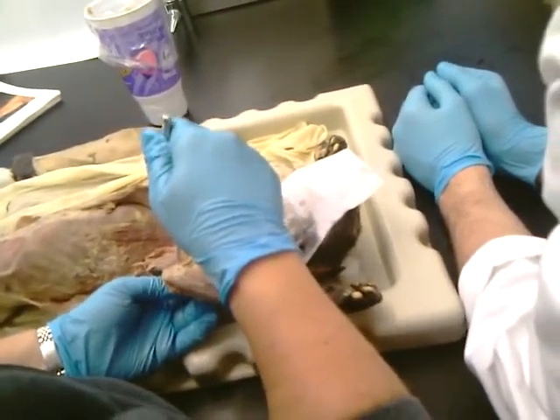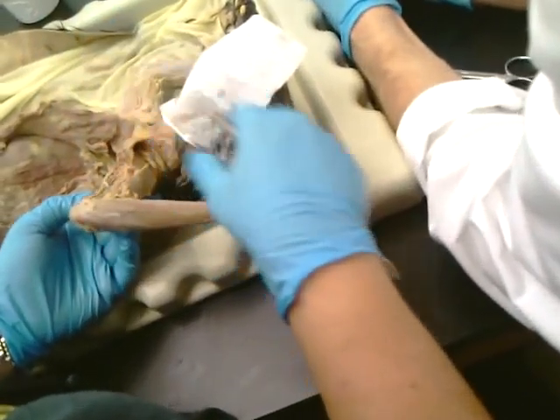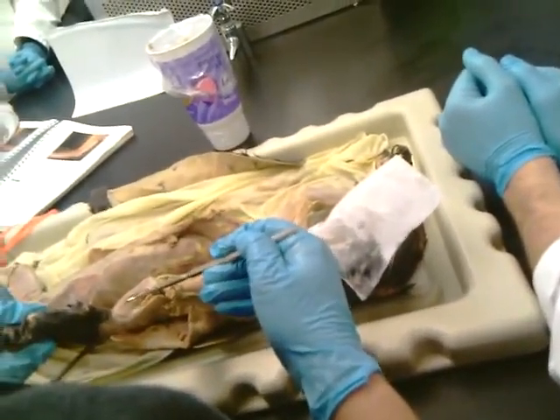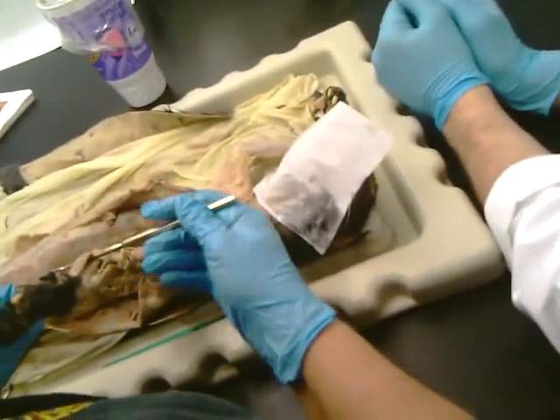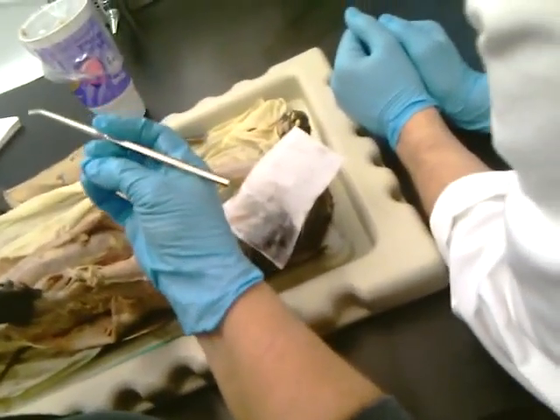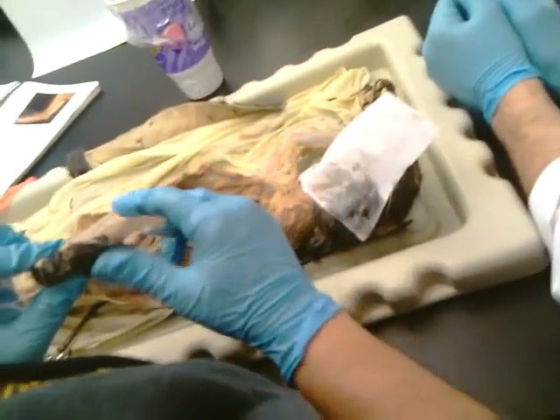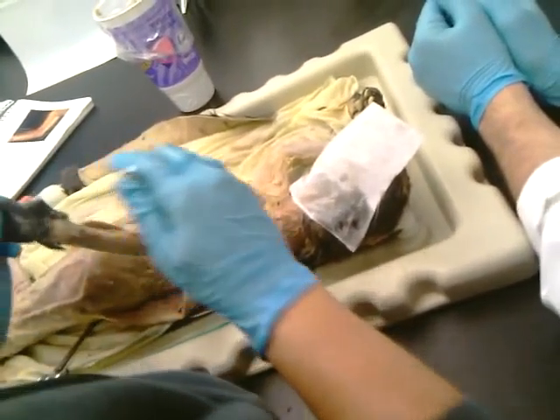So what muscles are these? Okay, and then what's the one here in the middle, going toward the palm of the paw? Palmaris longus. Okay, right there. The big one, where our palmaris longus is puny, it's well developed in the cat. Okay. So where they can land on their feet all the time? Actually, that's reflexes.